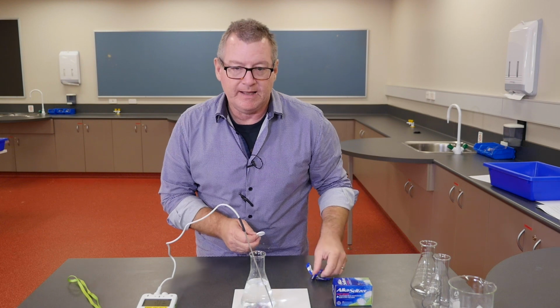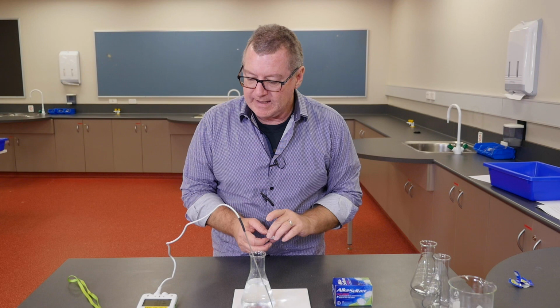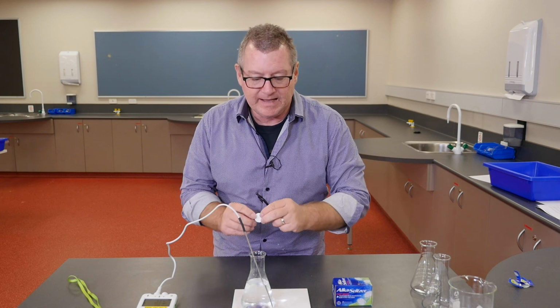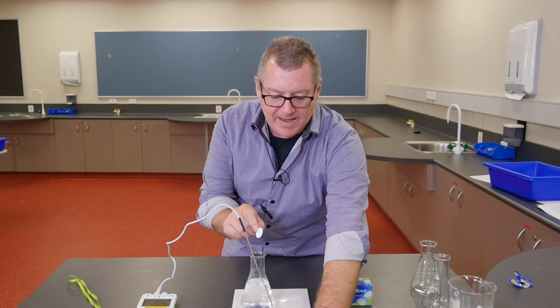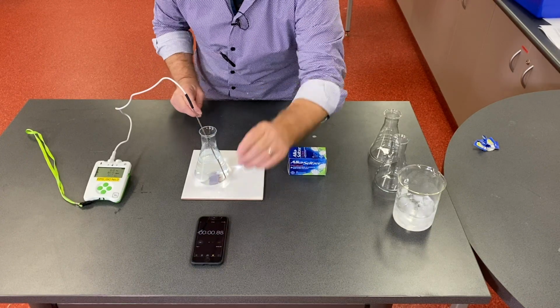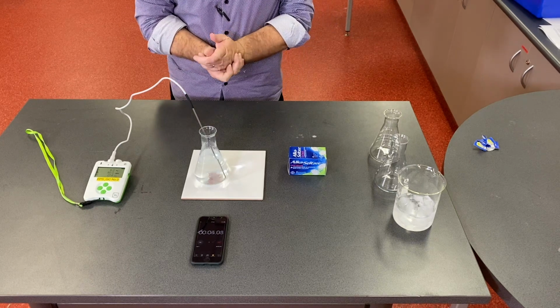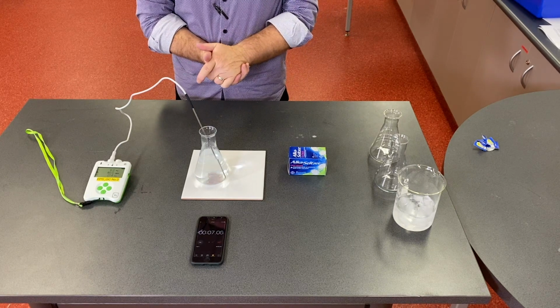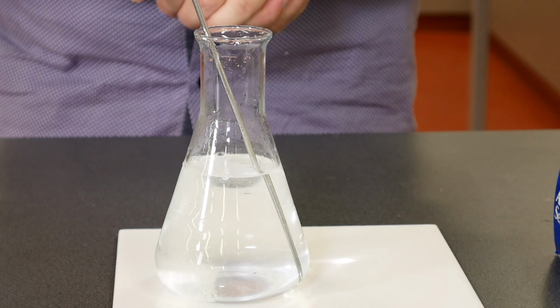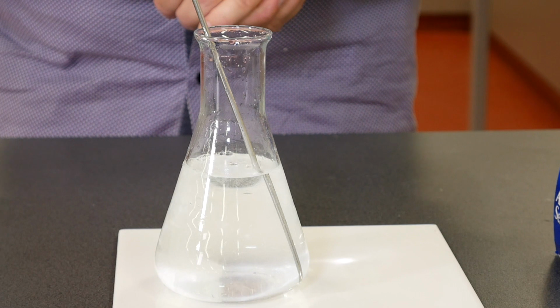So it's not zero, it's close to freezing point, but not quite zero. So around about 6.3, and we'll do the same thing. Time how long it takes to react completely. You can see the fizzing is there, but it's slower. It'll take longer before the step where it floats up.